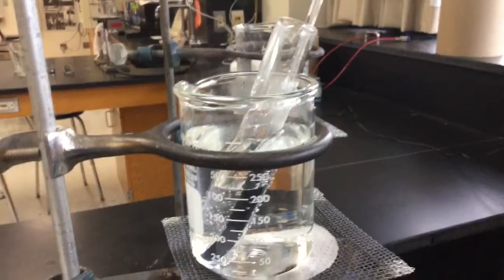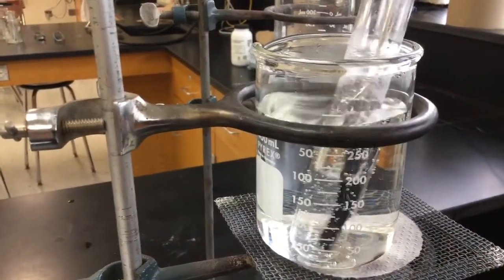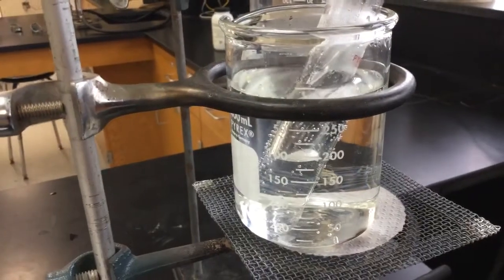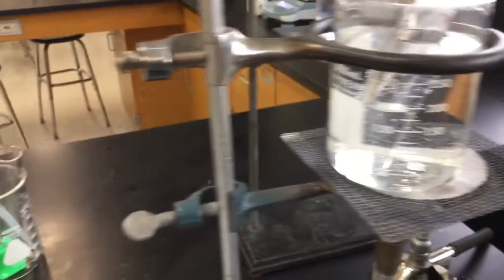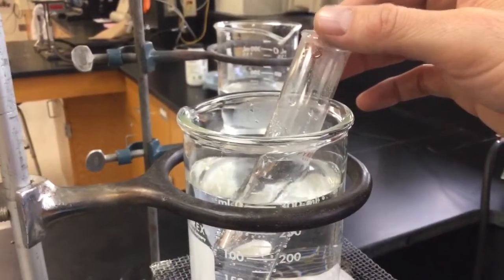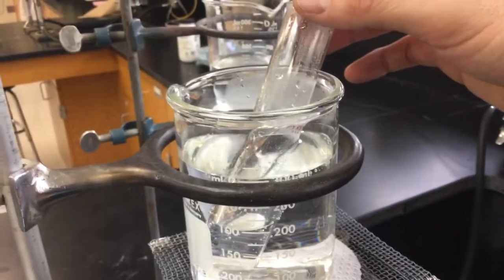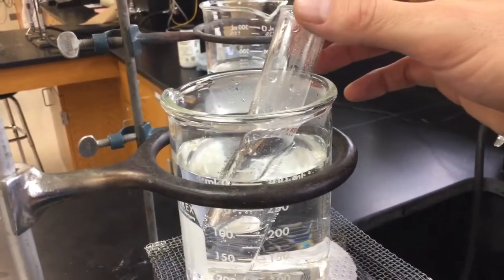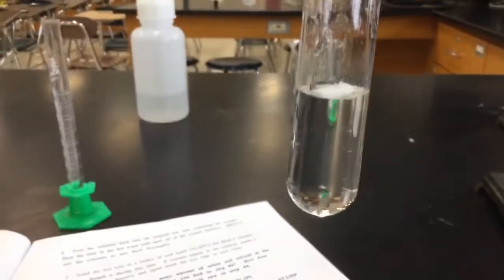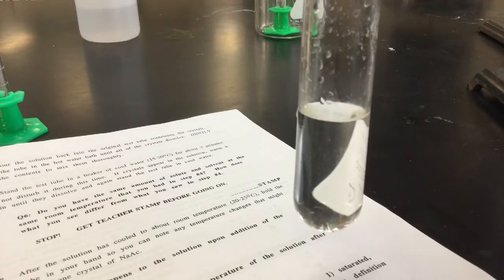I'm just about finished here. As you can see, there is no more solute in that test tube — the solvent has dissolved all of it. I'm going to take the rubber policeman out and turn off my flame. The top of the test tube is actually cold enough for you to touch, so you can grab it that way; otherwise, use the test tube clamp or call your teacher. You had 15 grams of sodium acetate in there with only 5 mils of water, and the water is now tricked into holding more than it should. As this cools, it's supersaturated — but really, really unstable.